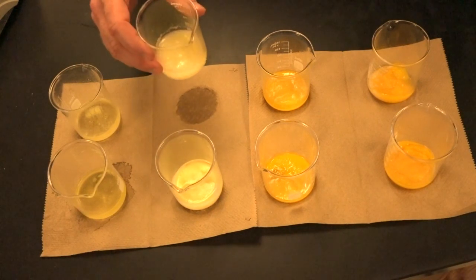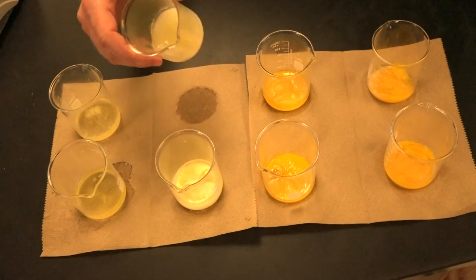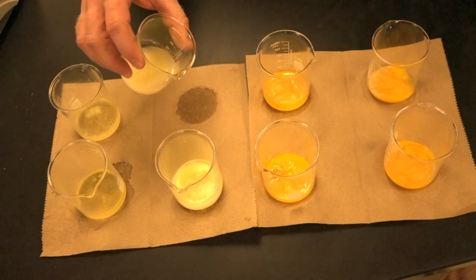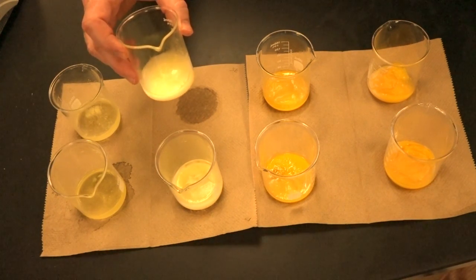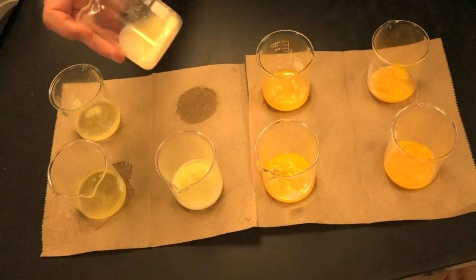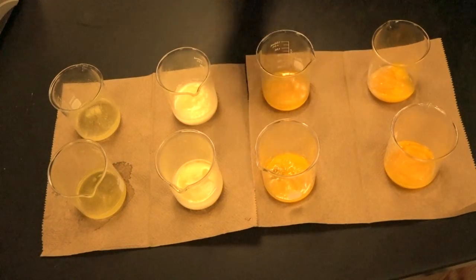Keep in mind, bear with us that, because of the way we're cooking this, it's not going to be perfect. But notice the extent of the denaturation that's happening here, okay? So still using those same words, transparent, translucent, opaque for appearance, and then liquid, semi-solid, and solid, okay? Coming over to the yolks, same idea.